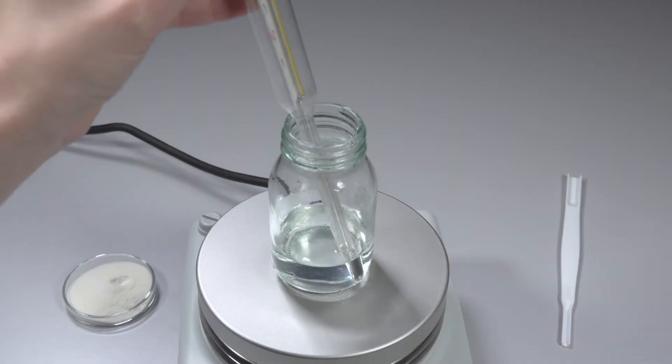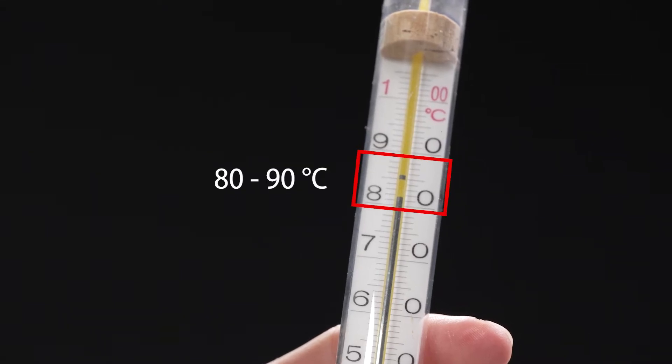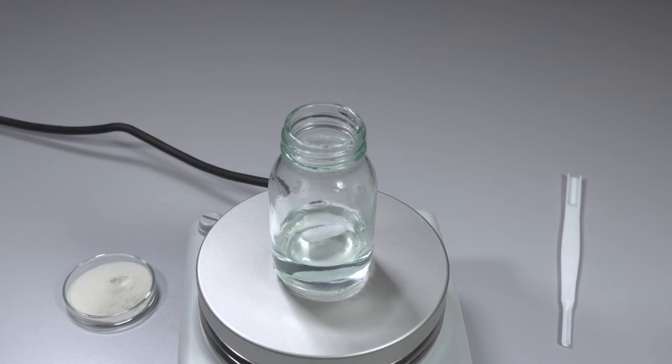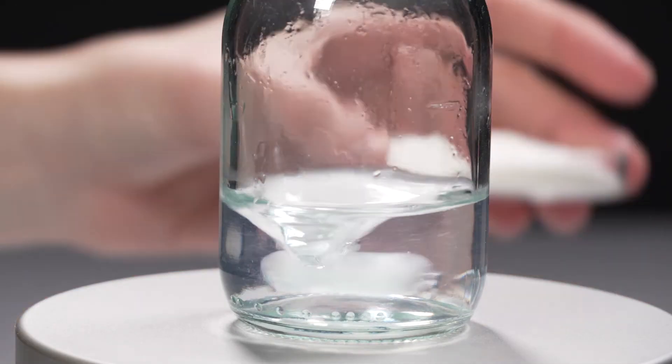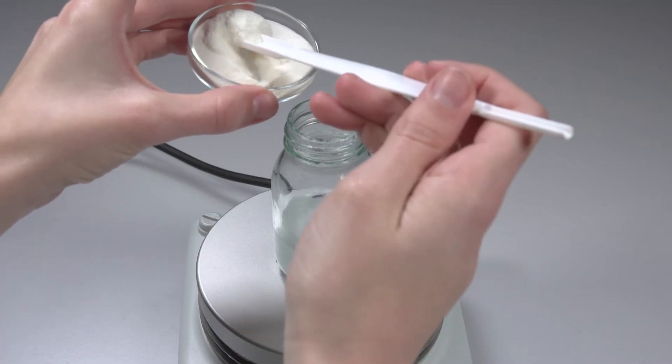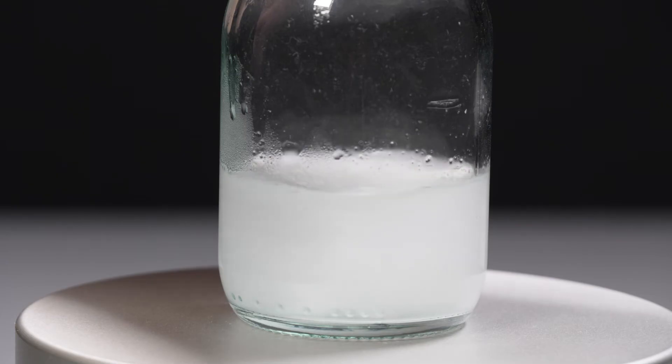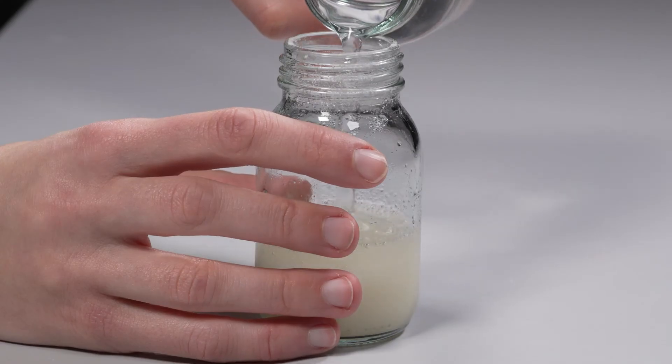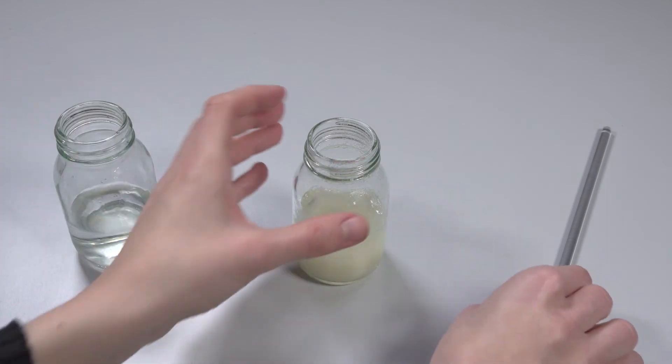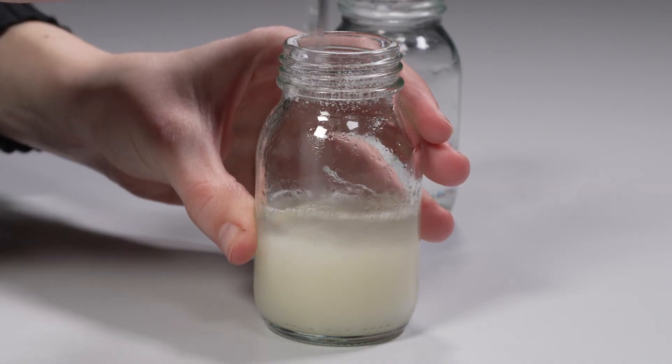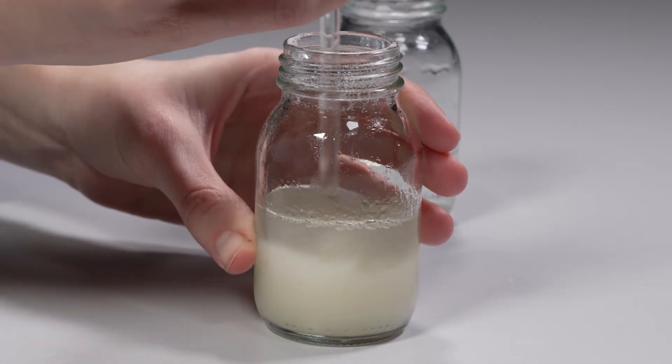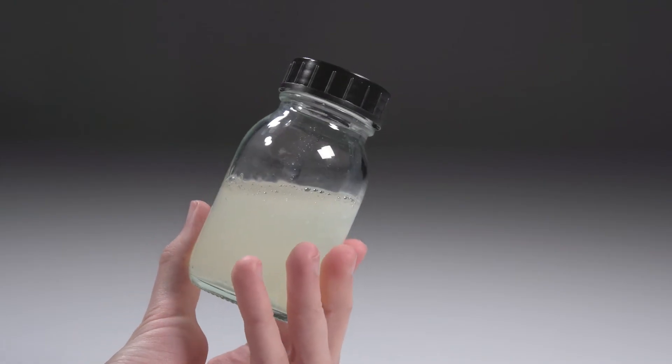Next, the glass is heated from 80 degrees Celsius to 90 degrees Celsius on a hot plate. The cellulose ether powder is stirred in slowly. Once the powder is dispersed, the mixture is removed from the hot plate. At this point, it is easier to stir the highly viscous mixture by hand. Now the remaining cold water is added and stirred with a glass rod until a smooth solution is formed. The cooled solution is now ready for use.